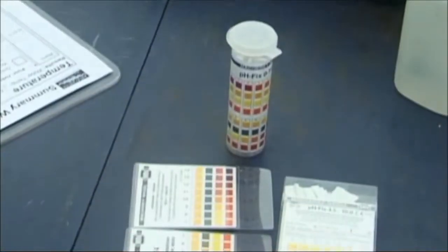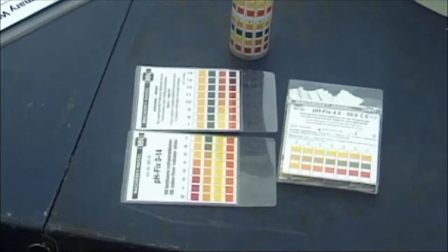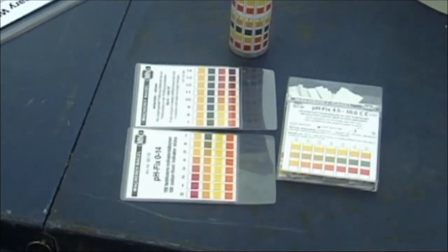There are different types of pH paper. Some measure in full units and some in half units.